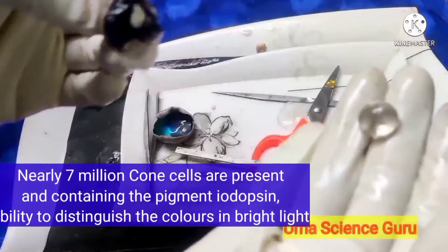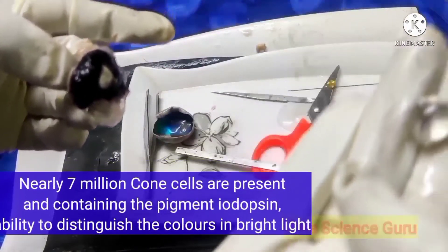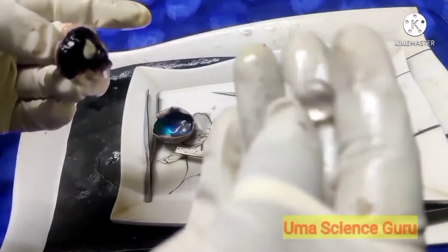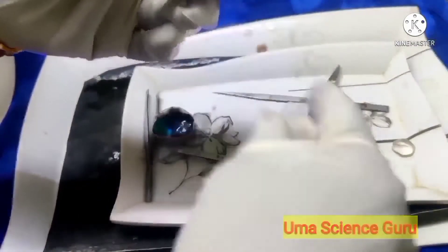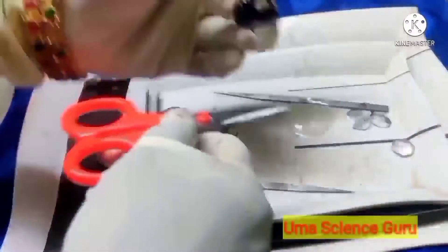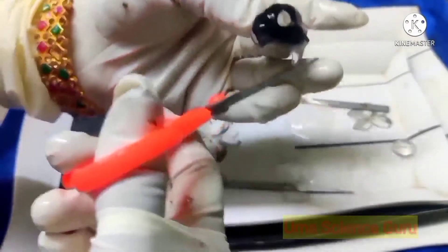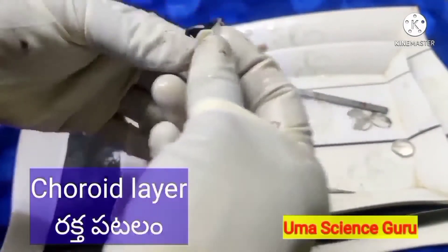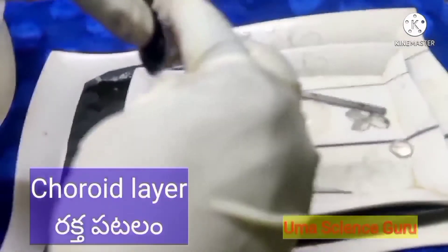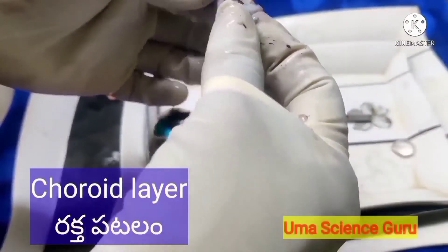Students, I have successfully separated the biconvex lens from the eye. It is an amazing real and natural biconvex lens. Now let us separate the remaining two layers — the choroid layer and the sclera. Observe the choroid layer: it is black in color and contains a lot of blood vessels. It encloses the eye except for the part at the pupil. The part formed by the choroid layer around the pupil is the iris.